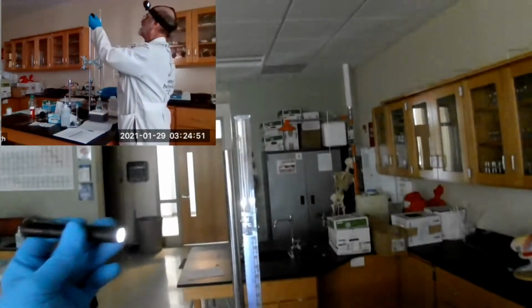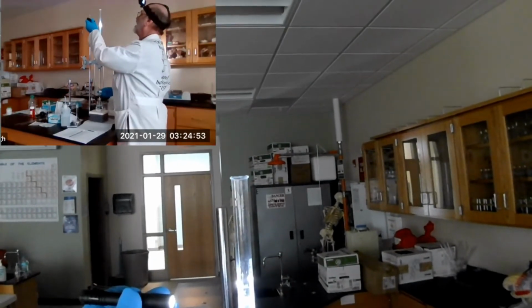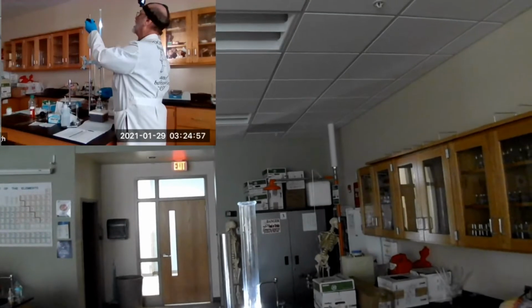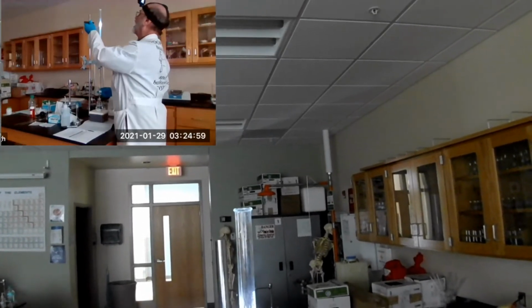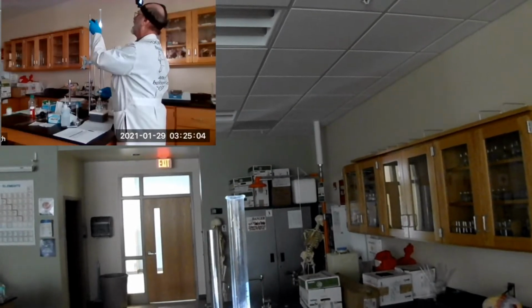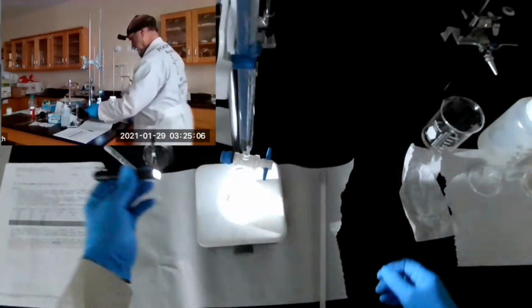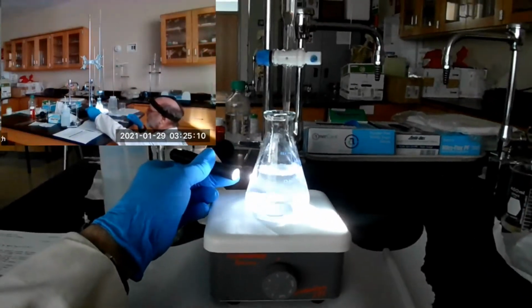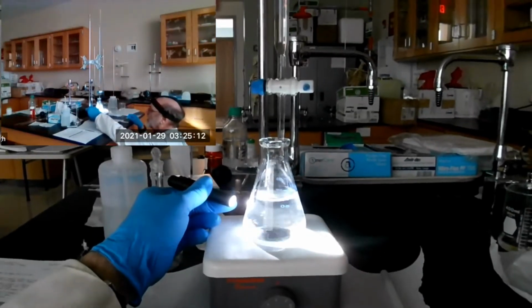Oh, it's a long way. So let's bring it down. Let me go down to 0.5 ml. There. Okay, you can see the light beam now, but does it disappear?